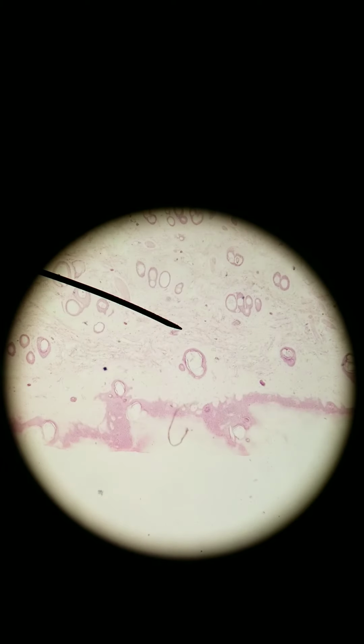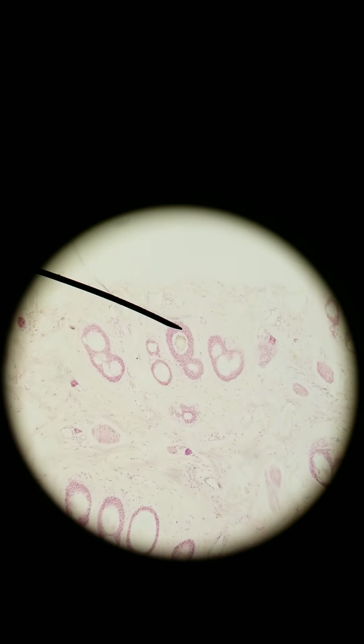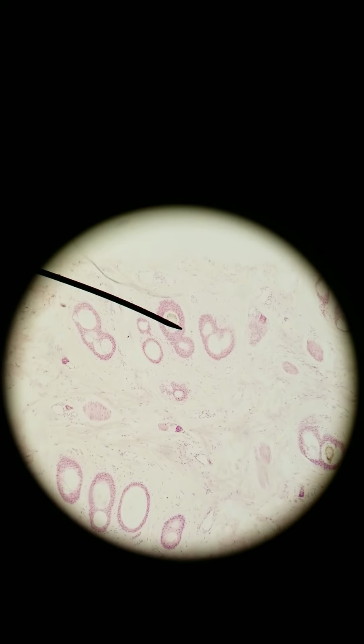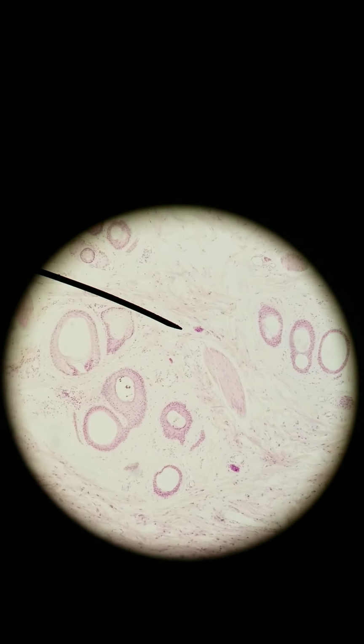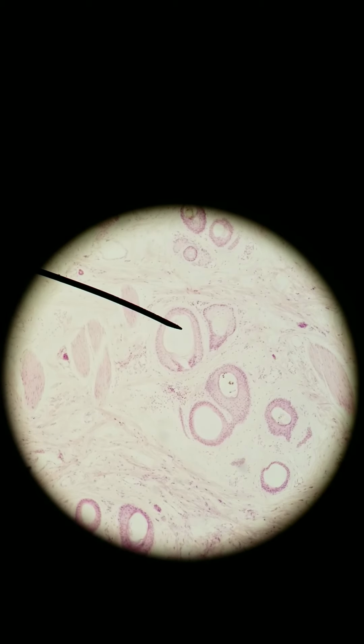But if we look at a horizontal cross-sectional cut of skin, we can find something different. Here we see a bunch of circles. Let me go a little closer to low power. All those circles are also hair follicles, but they're just cut differently. So this is something you'll need to pay attention to. How are your cells or structures cut? If it is an oblong shape, does it look like it's head-on like this? This would be a cross-section, or is the long view longitudinal section? Hamburger or hot dog?